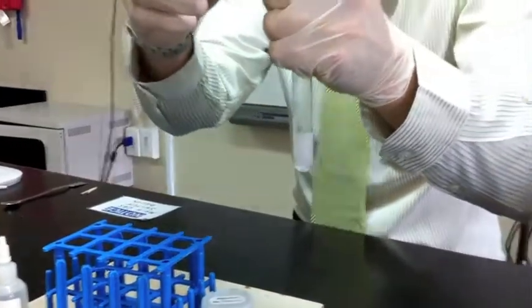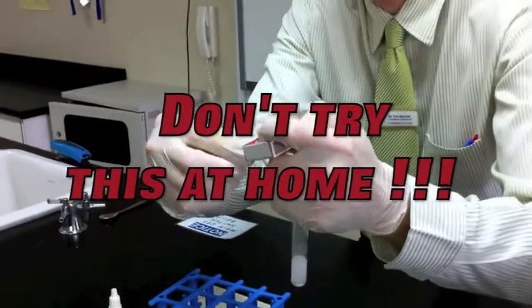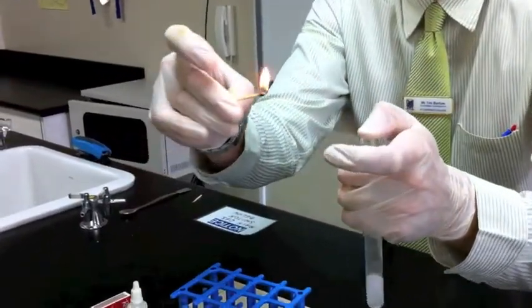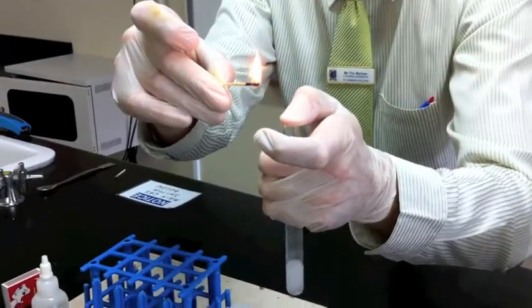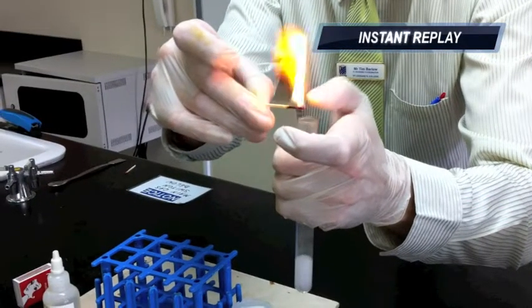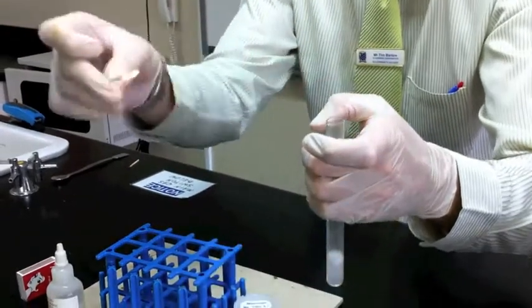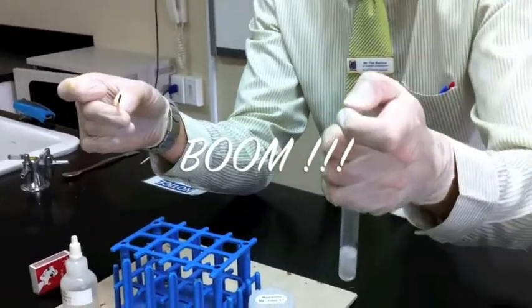Let's see what happens if we light it on fire. So don't try this at home, but let's just see if we can see what happens. So I've got my match here, I've got a bit of hydrogen gas here, let's see what happens. You'll have to listen, it might make a bit of a noise. Okay, so you might have heard that. It exploded in my hands.